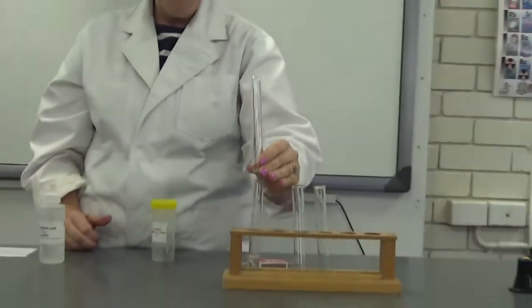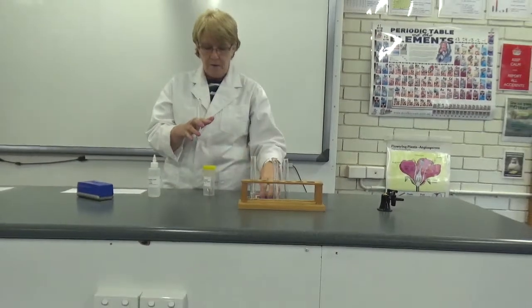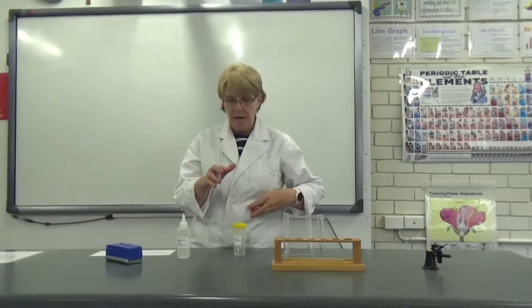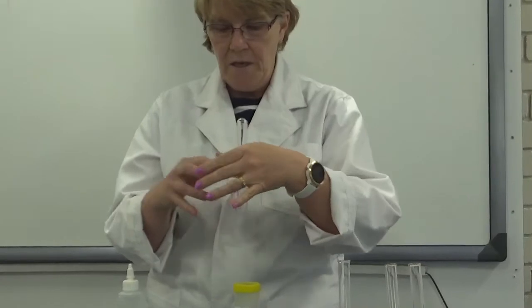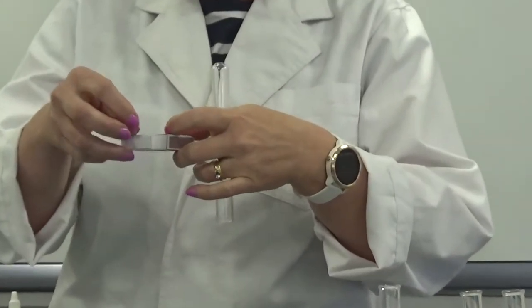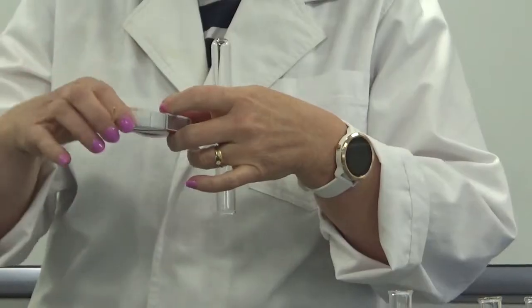Hopefully, that's enough gas collected. Now, I'm keeping the test tube upside down. Because the hydrogen gas is low-density, it's not going to come out of the test tube. It's going to stay more up the top of the test tube.